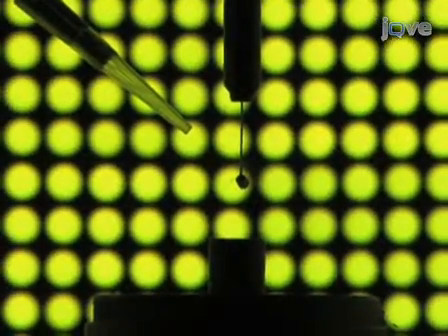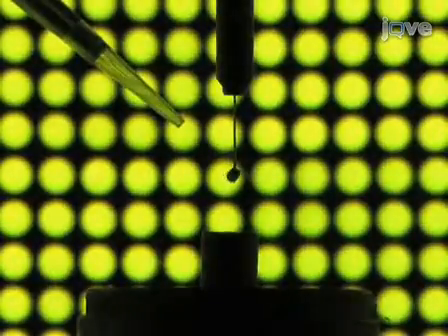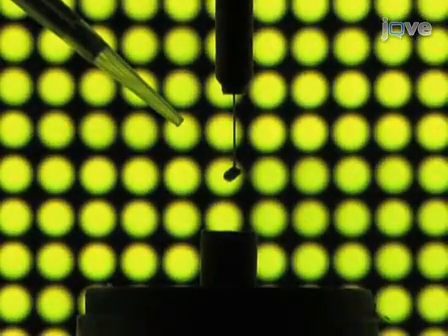Before every experiment, using the visual display, rotate the fly for several revolutions to ensure smooth motion around the entire 360-degree yaw axis. Discard the fly if it does not spin smoothly. If the problem persists, the magnets may be misaligned. Next, present the fly with the following experimental conditions in random order.